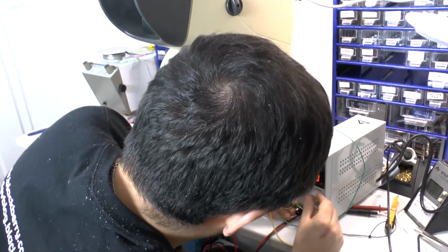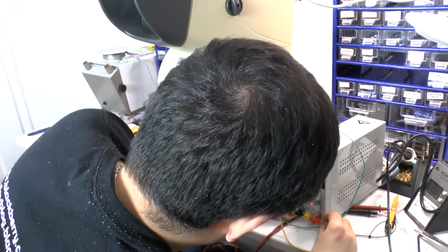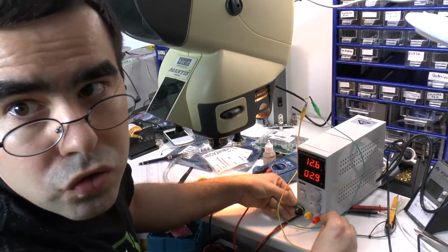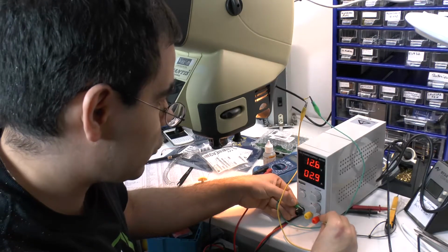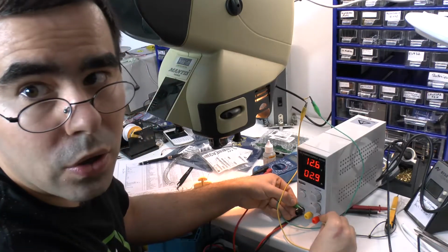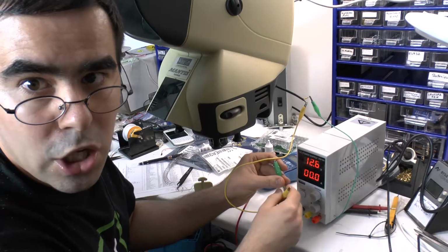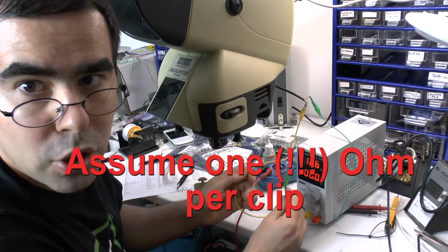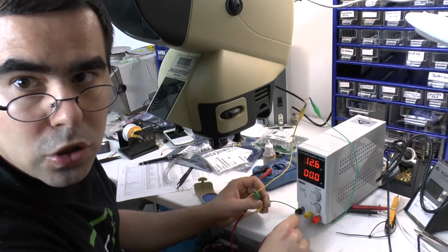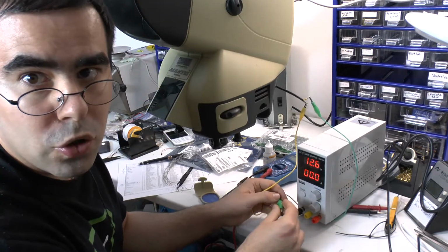Let's increase the voltage a little bit more. Limit the current. And we see the fan's running and everything's up. Success for now. And well, you really shouldn't use alligator clips for this because these really heat up. So we have to, on the long run, add an extension cable to the power supply because these will burn up in a minute or two.